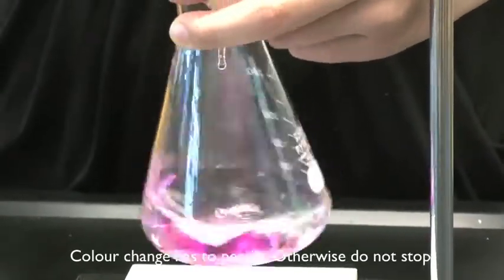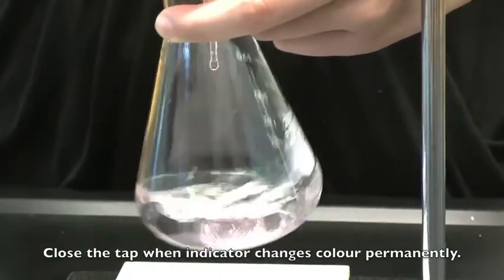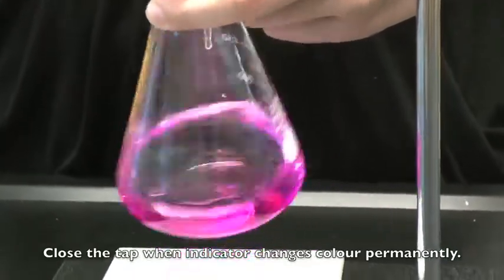The color change has to persist. Only then is the titration considered to be complete.